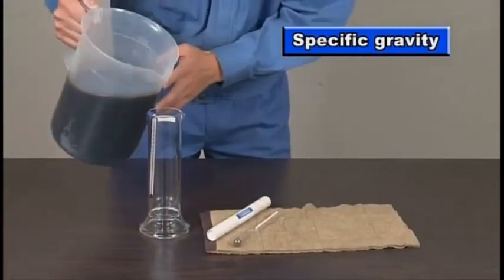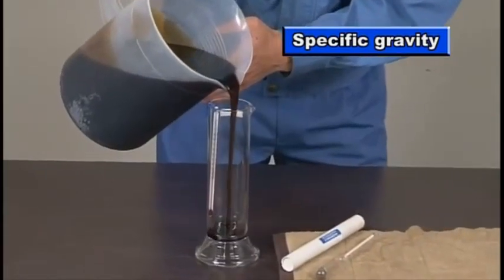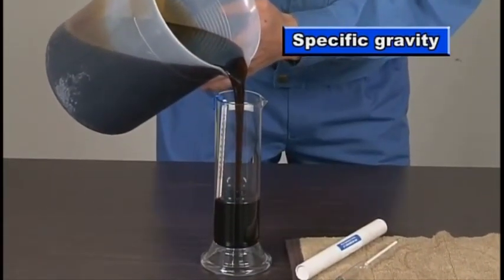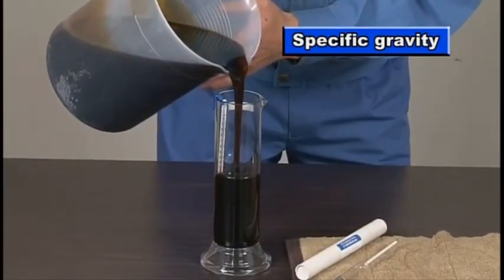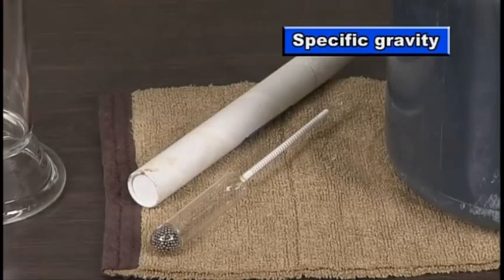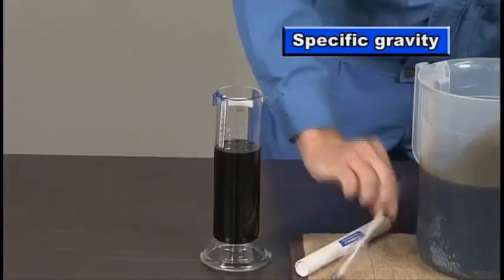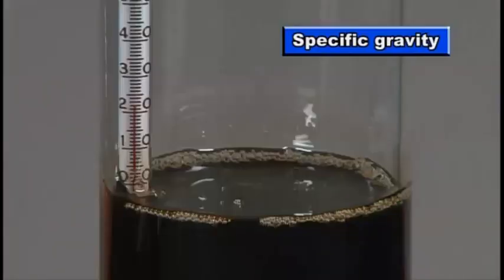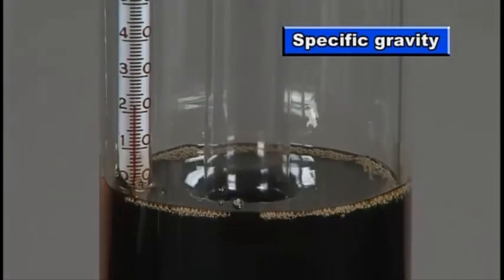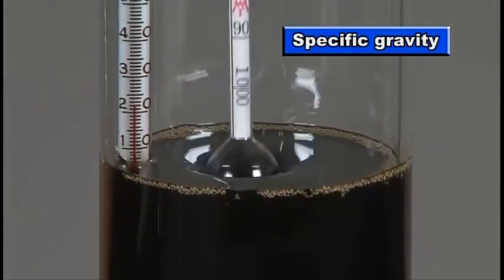Measure specific gravity. Place a hydrometer in the oil. Density is calculated based on this measurement.